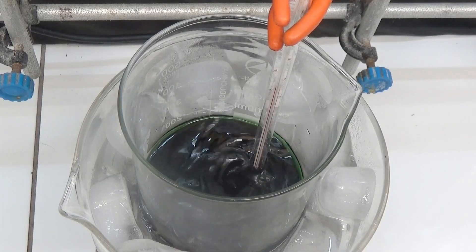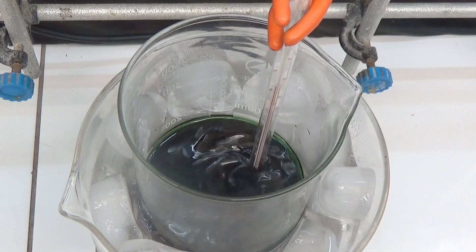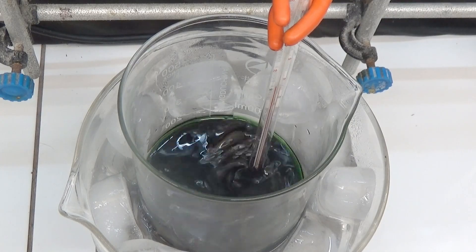The color of the reaction changes to green. The solution is continued stirring for 1 hour in cold.